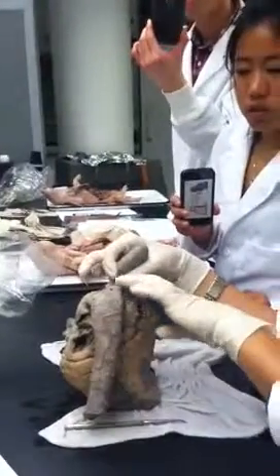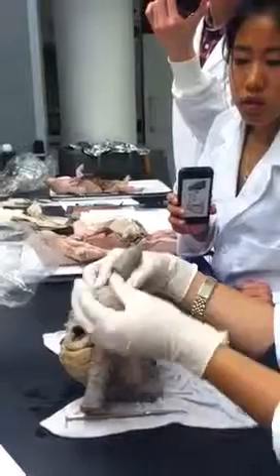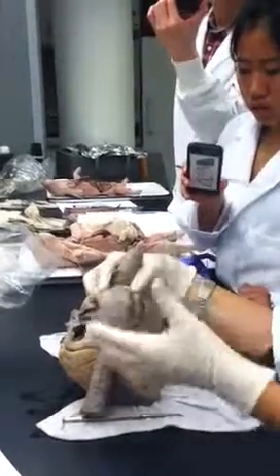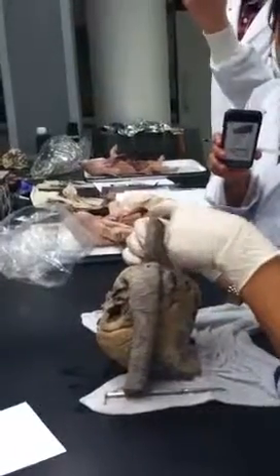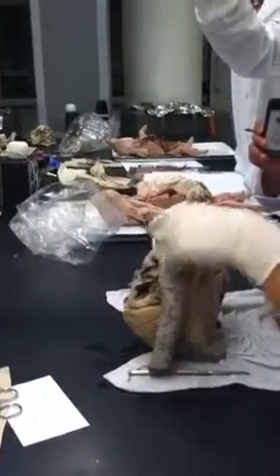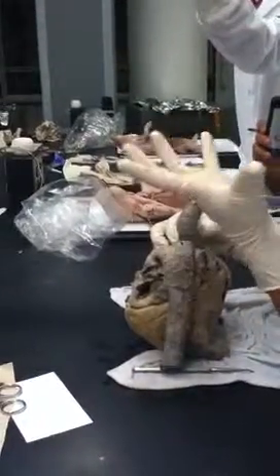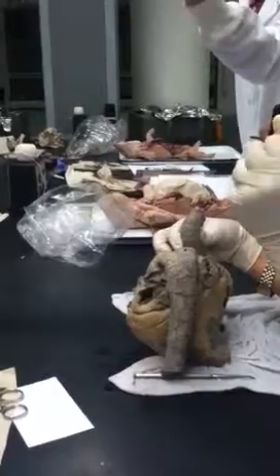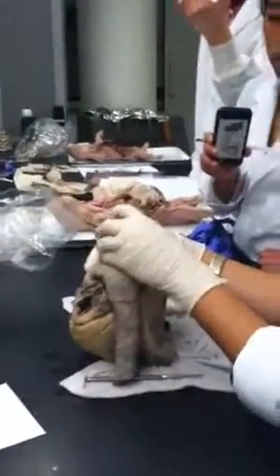Okay, so what is this guy? Arch of the aorta. Good. And then this would be the descending aorta. Once the arch is done, it's descending. So what is this then? It's coming off of the arch of the aorta, and it's really big. Brachiocephalic trunk. Yes, exactly. This is the brachiocephalic trunk.